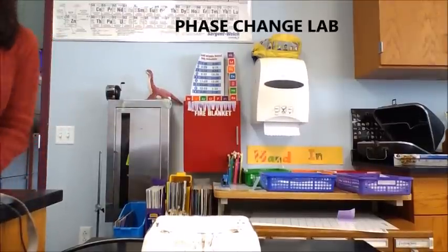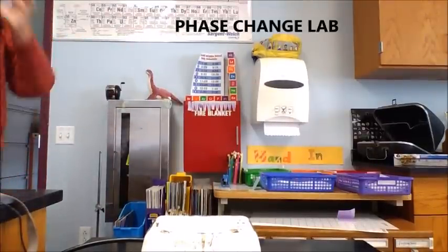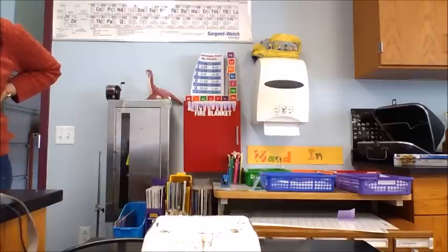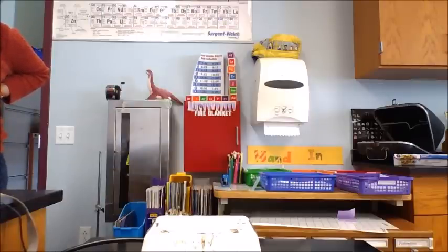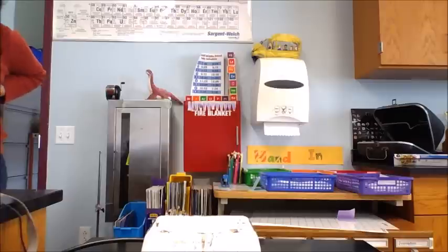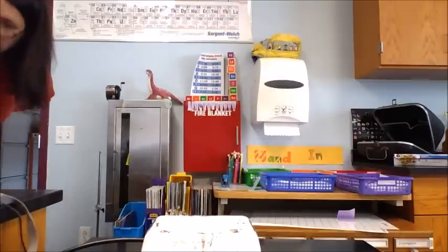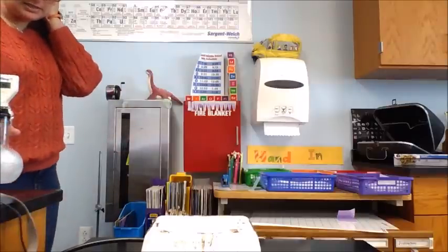This is your phase change of water lab. In front of you is a hot plate. I'm going to put a flask of ice on it. You should have your counter on the screen. I'm going to put the flask on when we get to 30 seconds, and every 30 seconds you need to record the temperature in your data table.